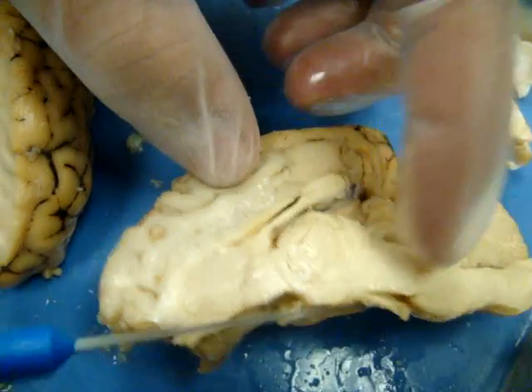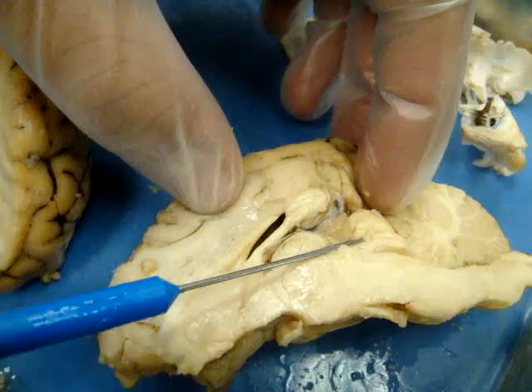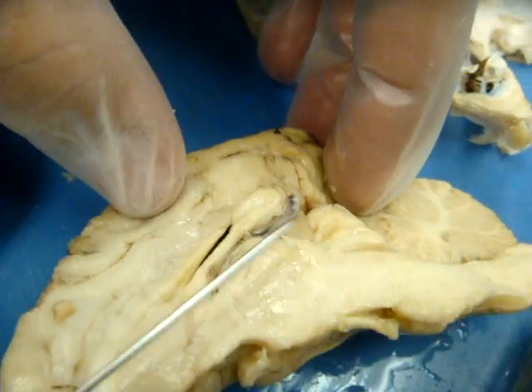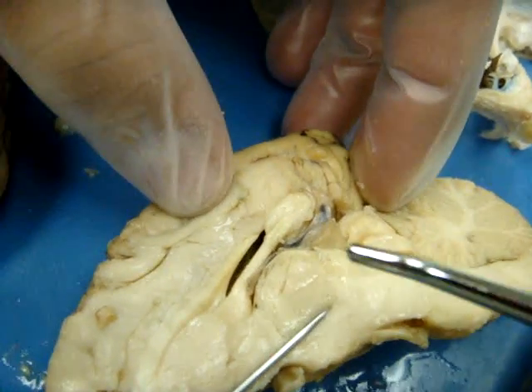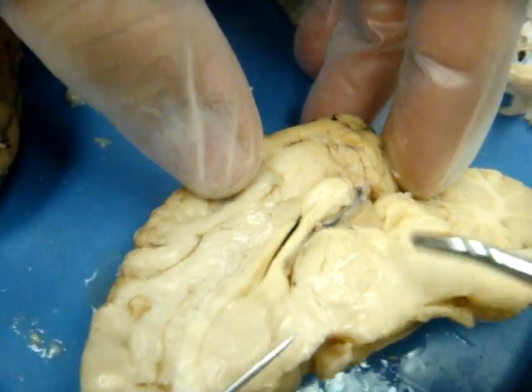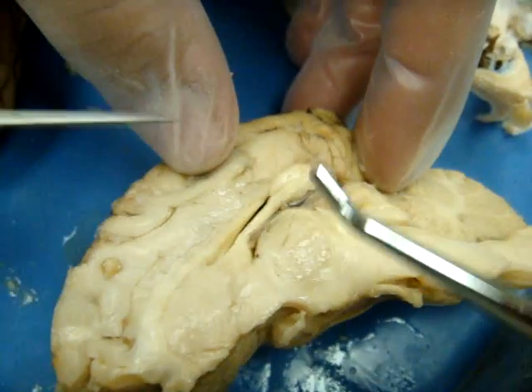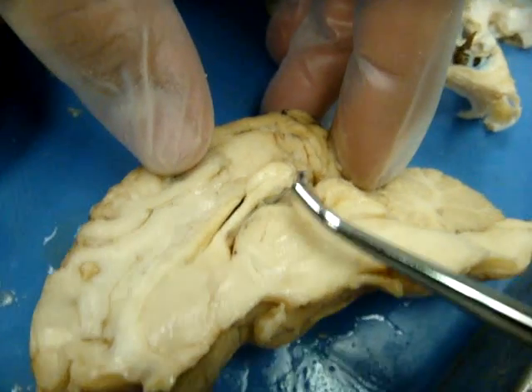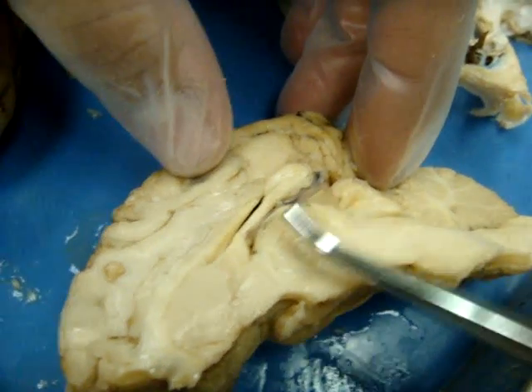You can't really see it, but it's around the thalamus. It's in this general area, but because it's between the two sides of the thalamus, it runs like that, so you can't see it.